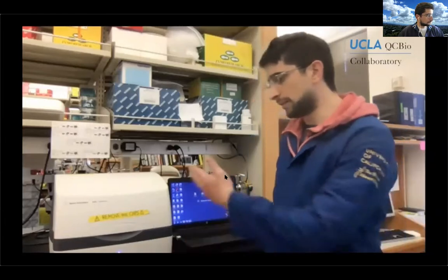For NGS. Today I'm pre-recording a lab session since, due to this COVID-19 situation, we are not able to be present here in the lab to have hands-on experience. So I'm trying to do my best to explain all the details about the experiments that we're going to perform today. Hopefully you'll have a sense of what it means to prepare a library for NGS. I'm actually next to the Agilent TapeStation, which is going to be our first topic today. And so let's get started.